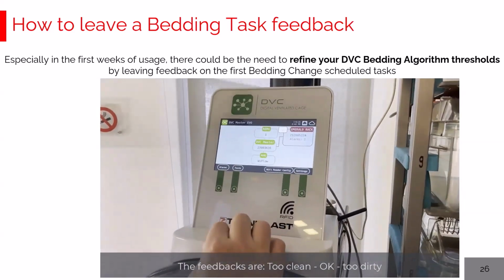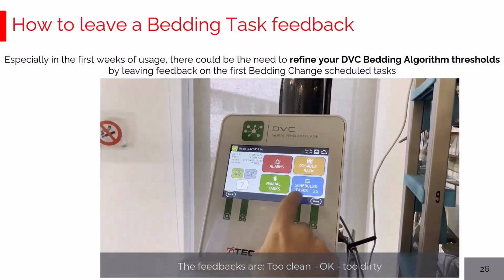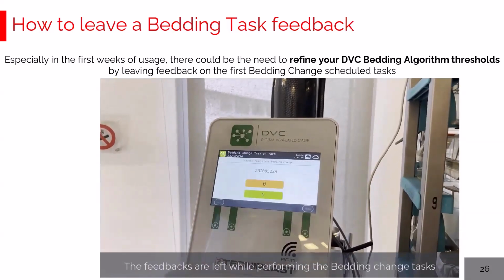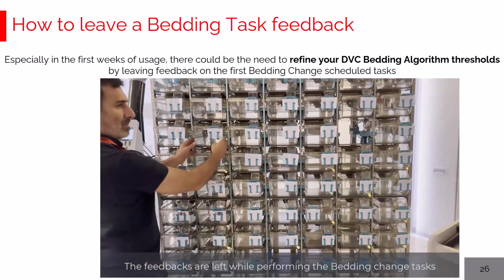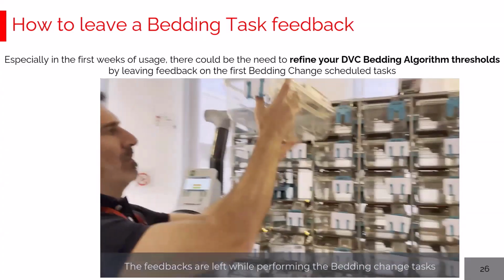Step number 1 is to enter the DVC master interface, select the rack, click on scheduled tasks, and then select the bedding change policy you want to follow. In this case, a total bedding change. All the dirty cages are illuminated in yellow, and you can start by removing the first dirty cage.